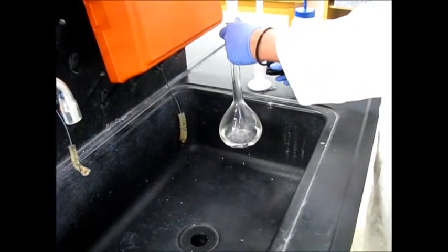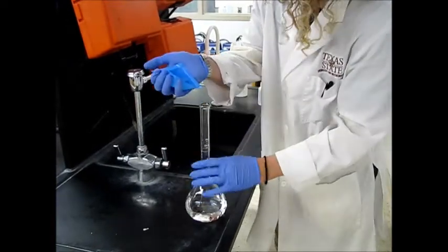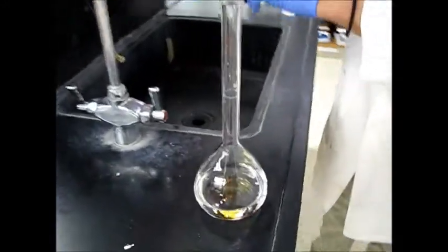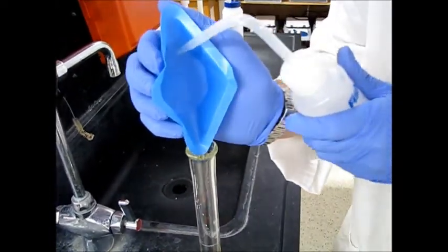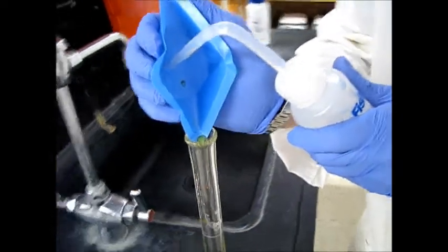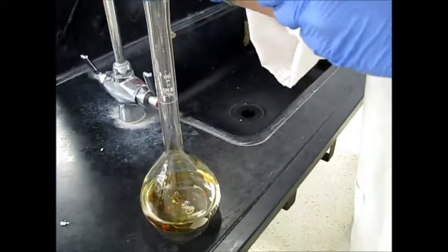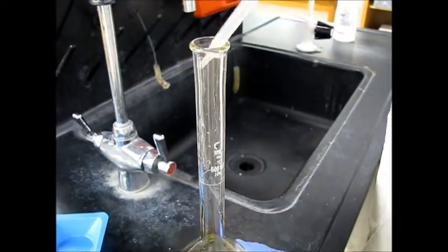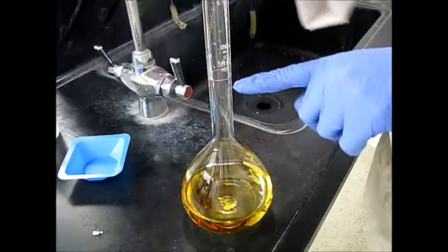So we'll add about 100, 150-ish milliliters of water. We will add our solid like this. Notice there are some specs still in the weigh boat. And like I said, you want everything to be very precise. So we're going to try to wash in every little bit of our solid that we weighed so that we account for it in our solution. We also have some stuck to the sides. So we're going to wash that down. Cool. And then we can dilute up to the fill line right here.